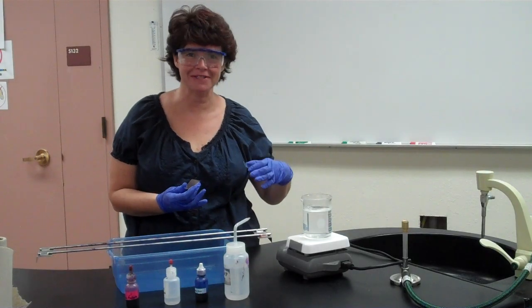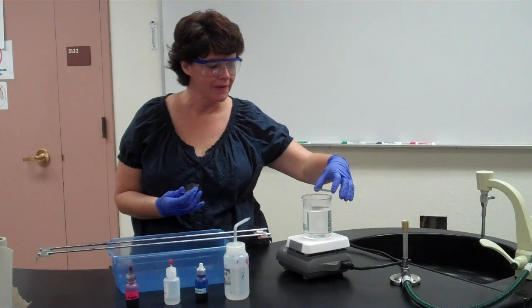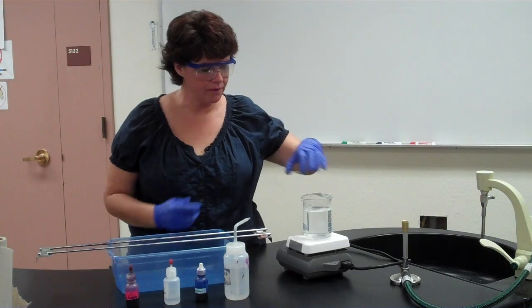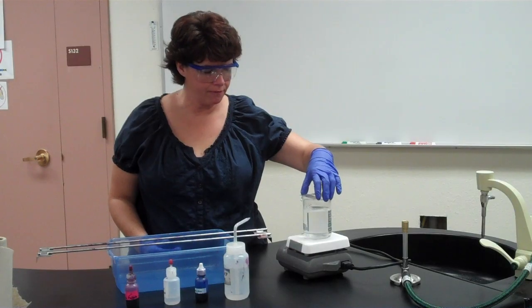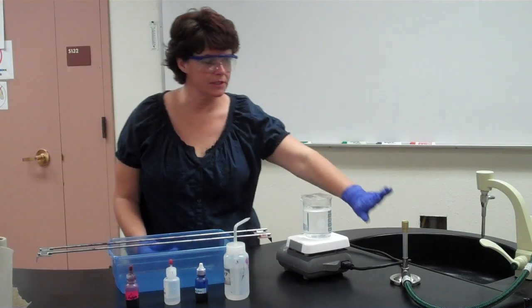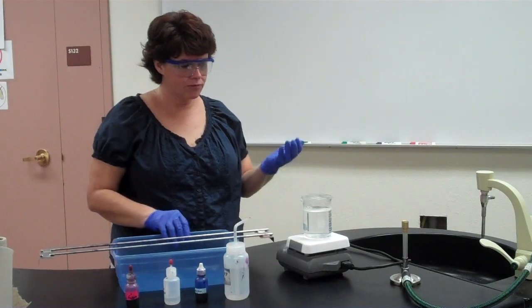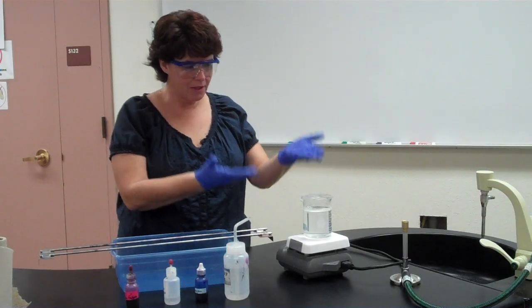So what we're going to do is I have my bacteria prepared, I've made the smear and I've fixed it. My left goggle is really steaming up. So now I'm going to gently place the slide with the bacteria fixed on it. It's already fixed. I've already done the Bunsen burner. Now you have condensation forming underneath there, and I can see the steam coming, so that's hot enough.